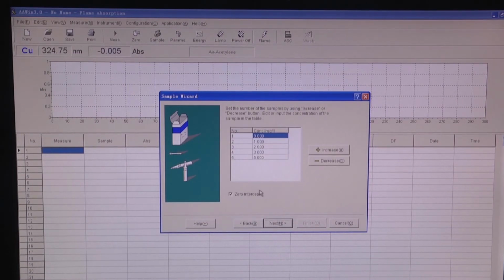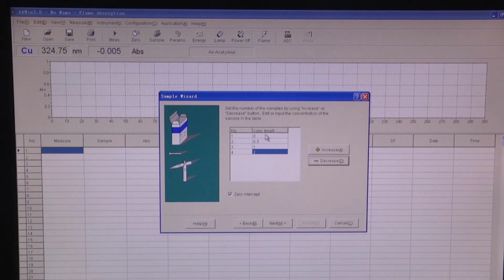This table shows the information about standard samples. We can add or reduce the number of standard samples by pressing increase or decrease. For the concentration, we can double-click and then input the concentration value manually. For example, we have 4 standard samples with concentration of 0 for number 1, 0.5 for number 2, 1 for number 3, and 2 for number 4. Then we press Next.